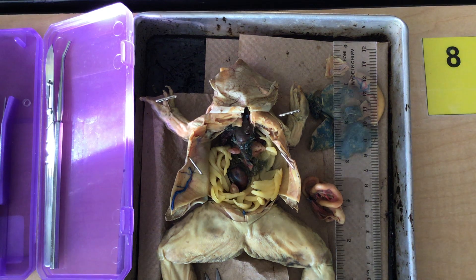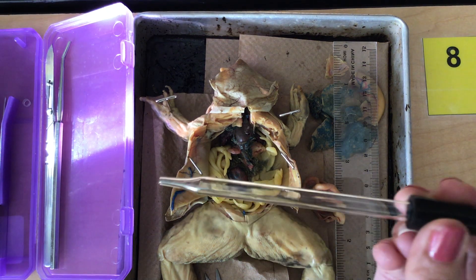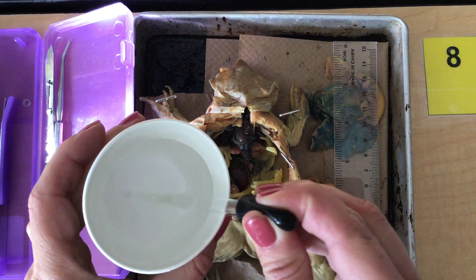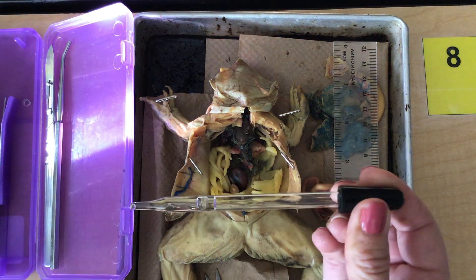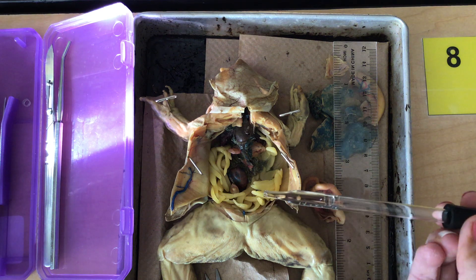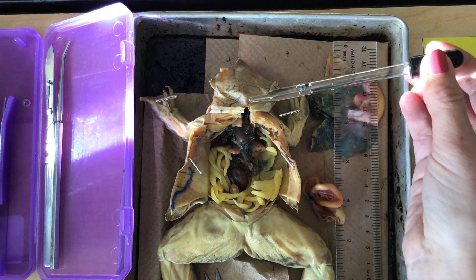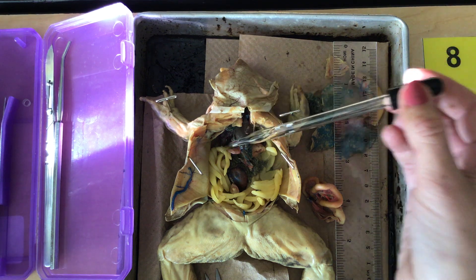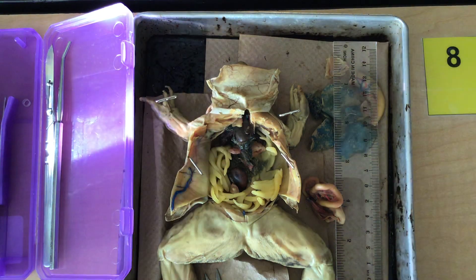And if you want to try this part, you can. You will insert a pipette full of water — just dip it in a cup of water; you can get one from by the sink. Taking your pipette, you're going to insert it gently into the glottis, so into the mouth at the very back, and you're going to try and inflate your lungs.